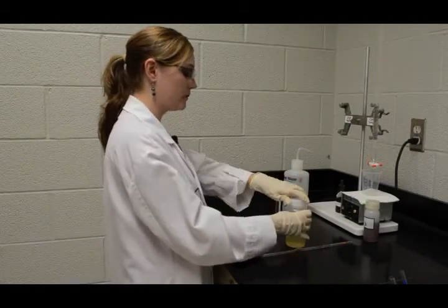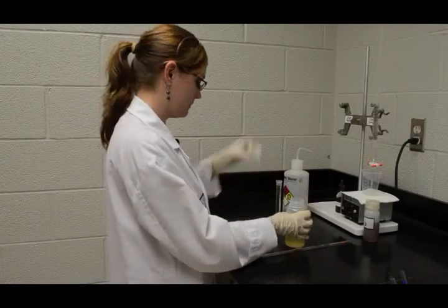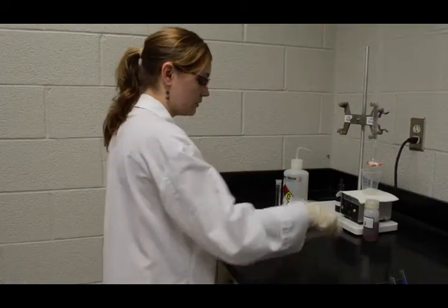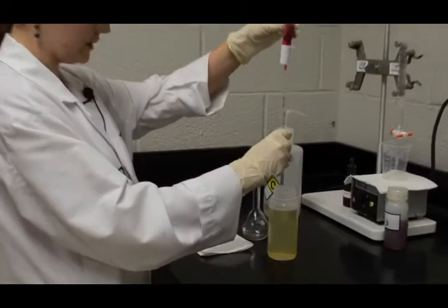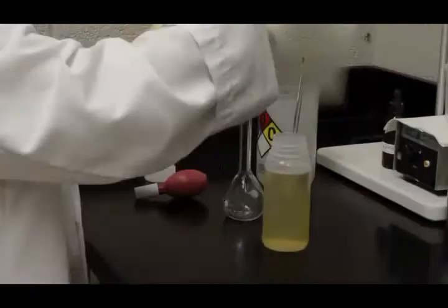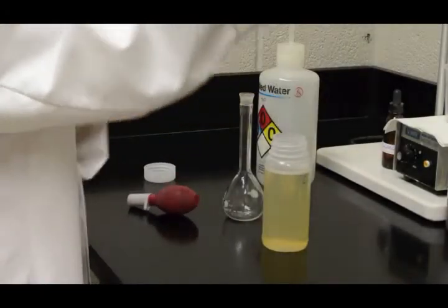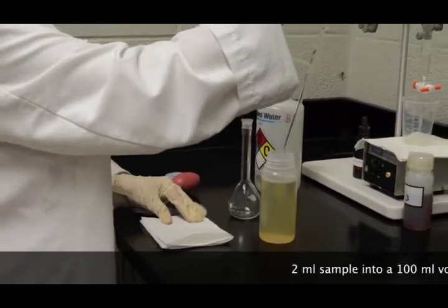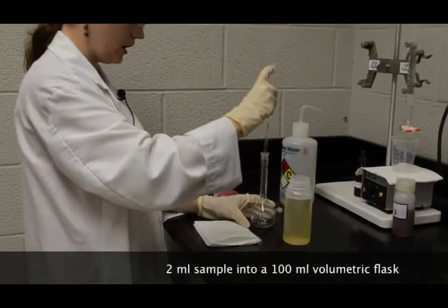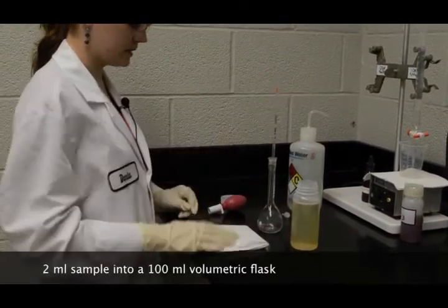We're first going to start by pulling a 2 milliliter sample of our 300 LF. Using our 2 mil pipette, we're going to pull from the center of the sample. I'm going to remember to wipe the pipette. And we're going to be placing the 2 mil sample into a 100 milliliter volumetric flask.